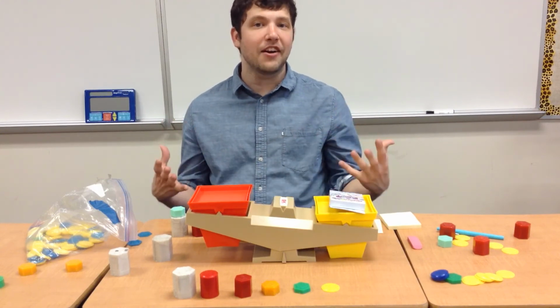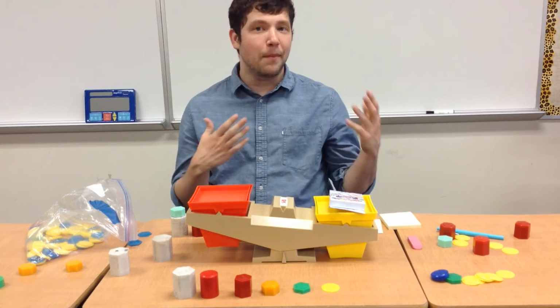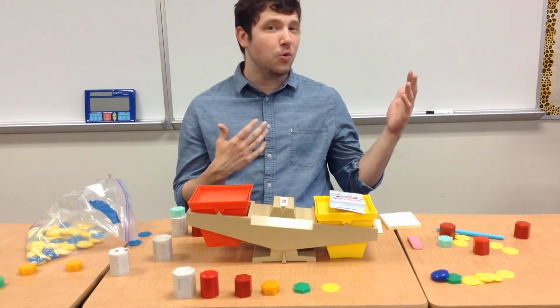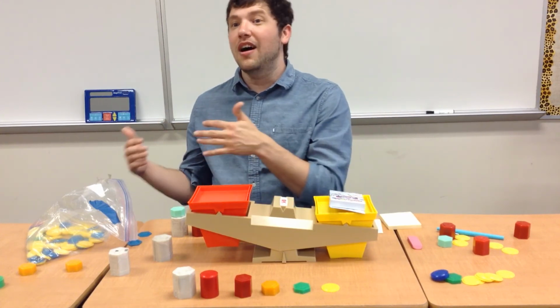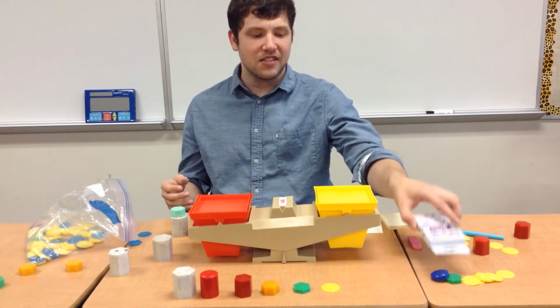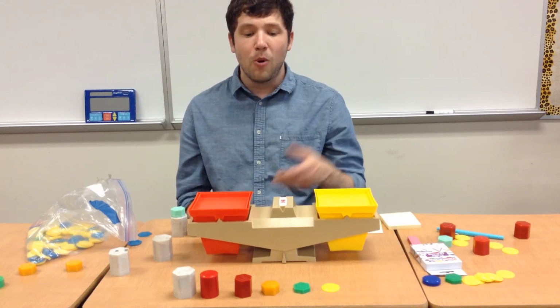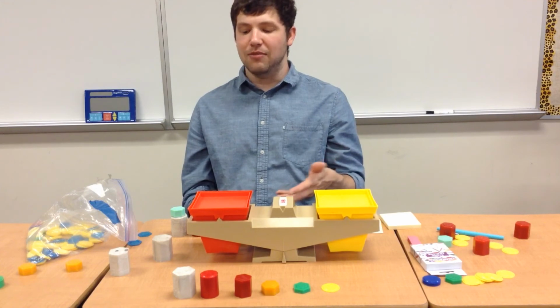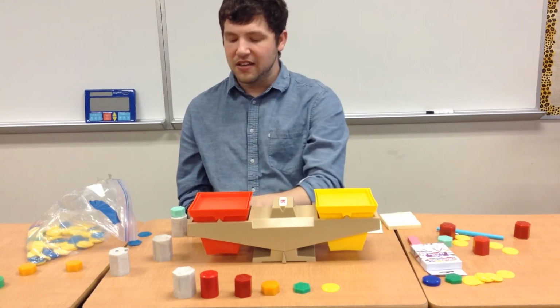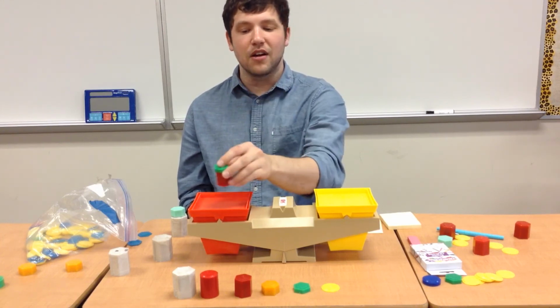Mass is how much matter we have and how much space we take up. Weight has our mass, but also factors in gravity. So that means how much we weigh on Earth and how much we weigh on the moon are different. We use a pan balance to help measure how much mass an object has. In order to figure out how much mass an object has, we have to place an object on one side and have something we know the mass of on the other side.